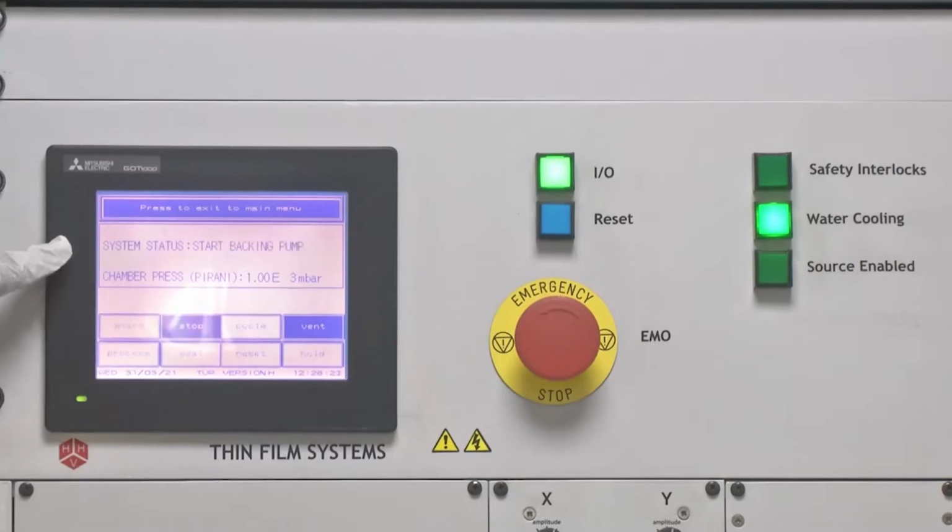So as soon as we press the start button, the first thing that comes to the display as a part of system status is backing. What does it mean? Backing valve is closed and roughing valve is open, which can create the base pressure for the turbomolecular pump. All these terms we will discuss now. So in an electron beam evaporation system, there are 2 chambers, there are 2 pumps.